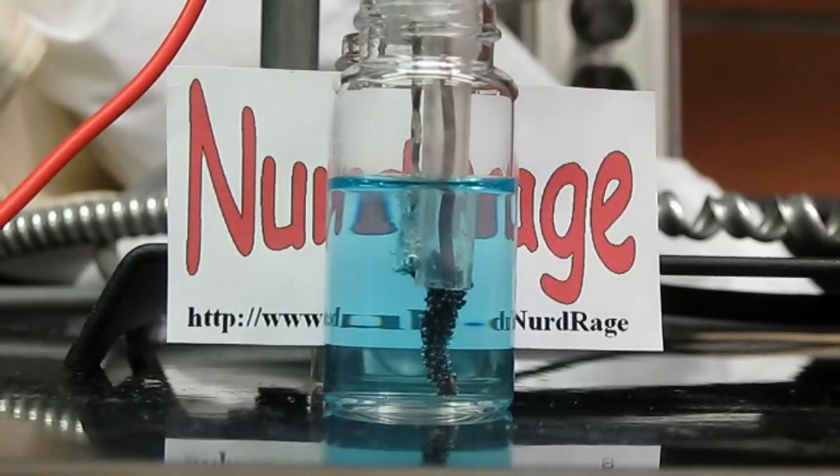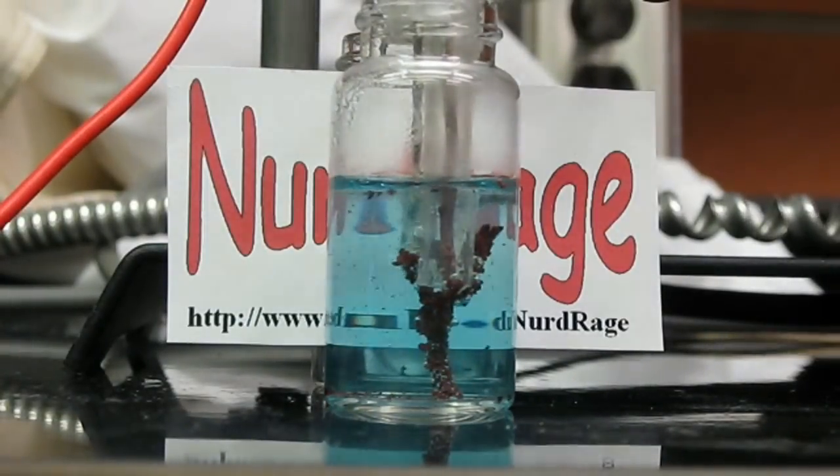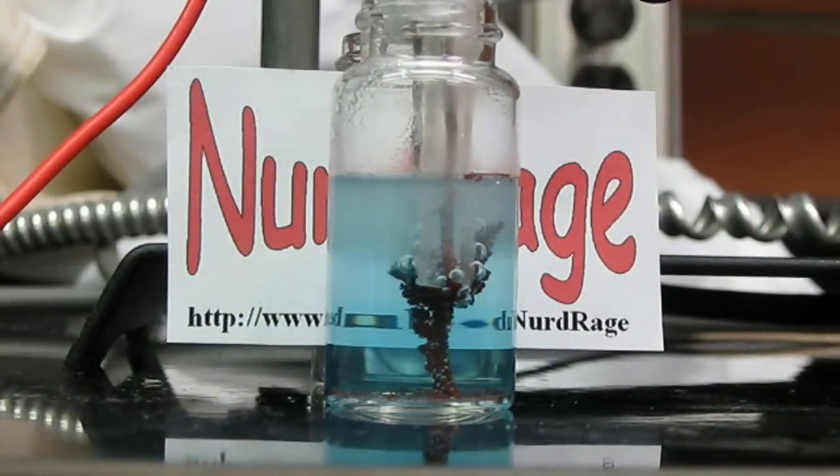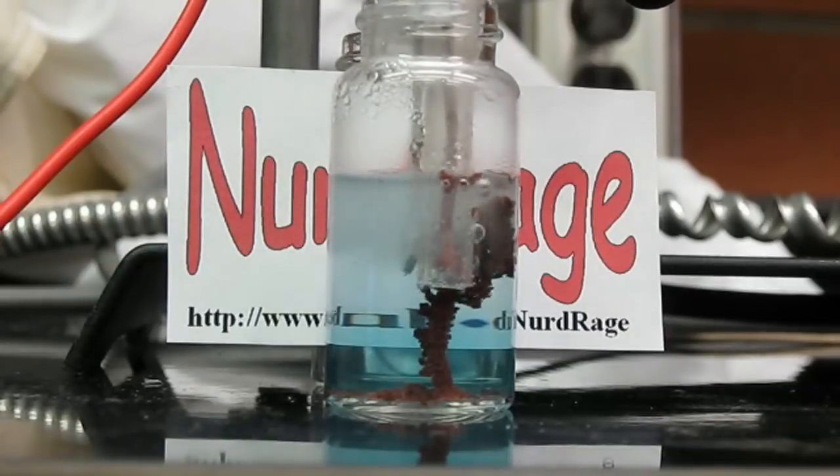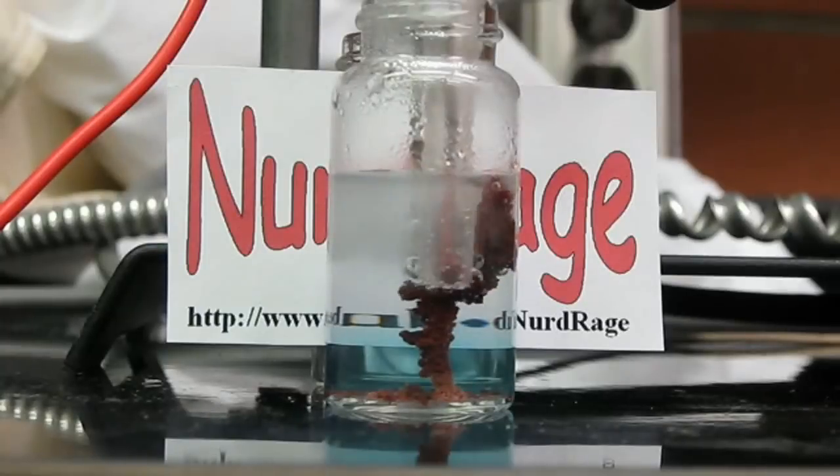Turning on the current now. Since the platinum dissolves extremely slowly, we can actually see the chemistry in progress. The blue copper ions are being plated out of the solution and onto the copper electrode as spongy copper. The solution is getting lighter as it's converted to sulfuric acid.